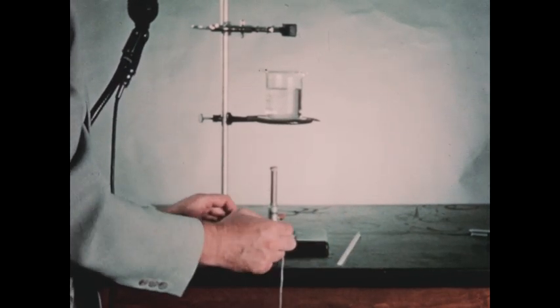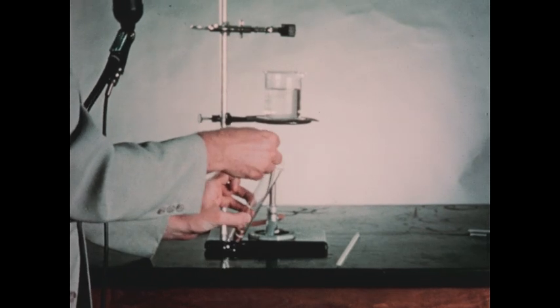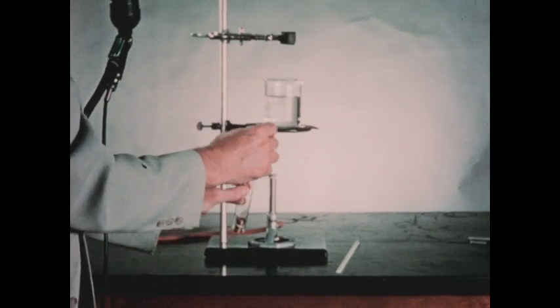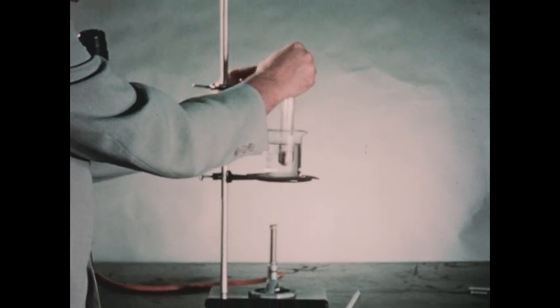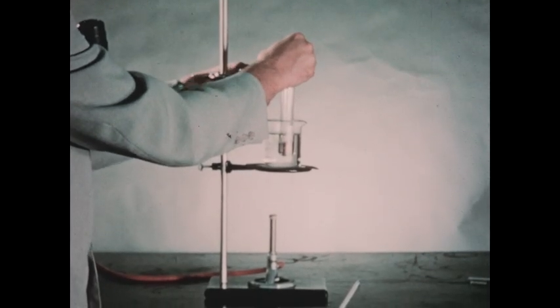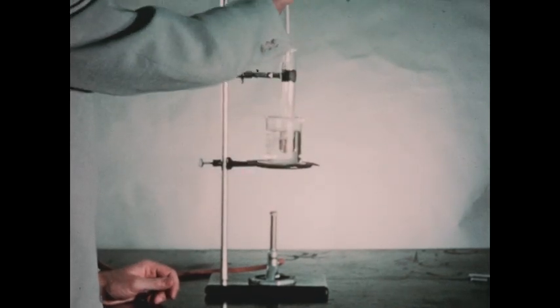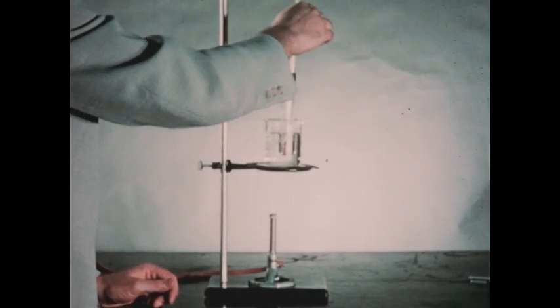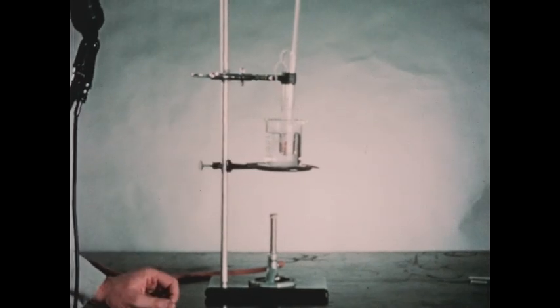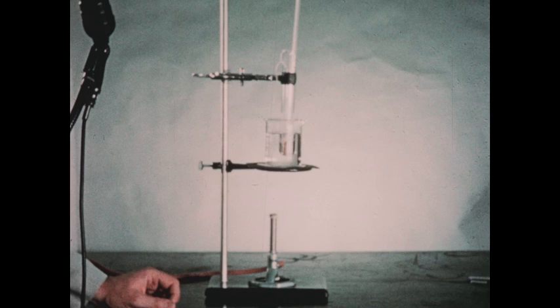We then place the copper in the test tube, slide it to the bottom with the string, place the test tube in the beaker of water, which we're heating with the Bunsen burner, and clamp it in place. We'll then place the thermometer with the bulb sticking into the copper block. We'll now boil the water and wait until the temperature of the copper becomes constant.